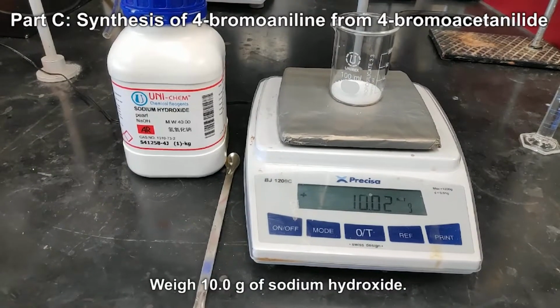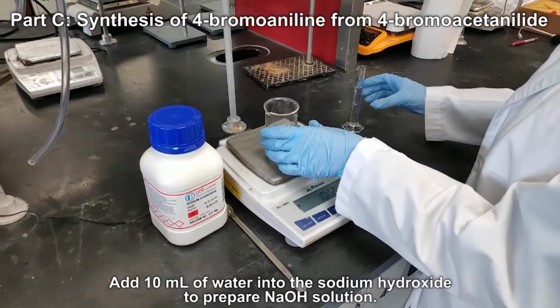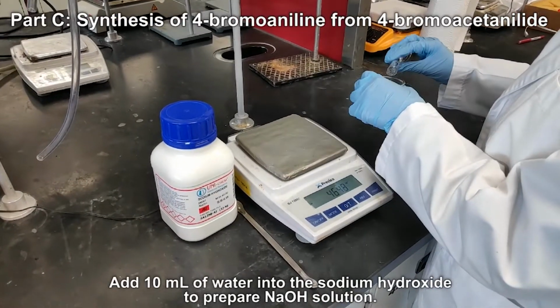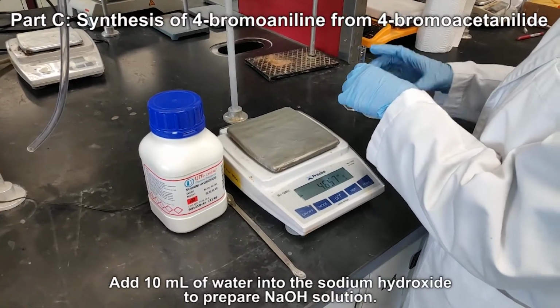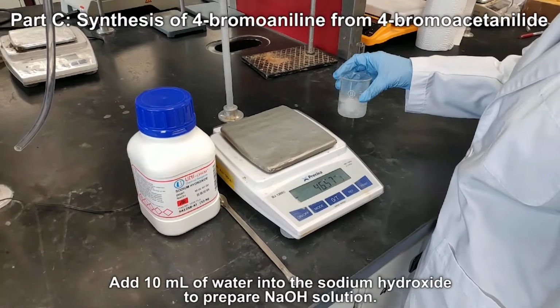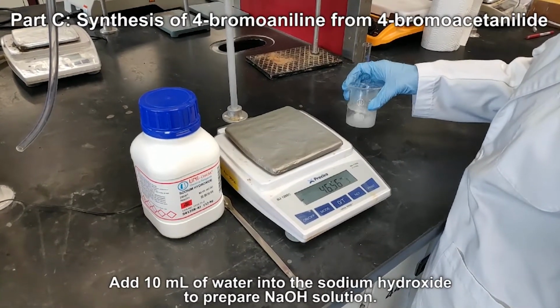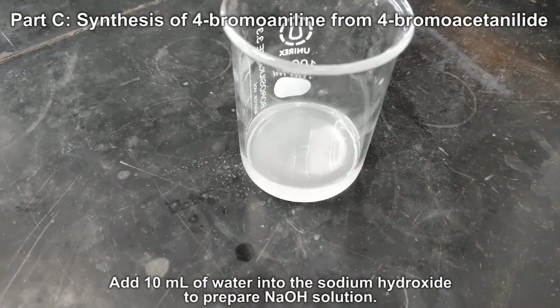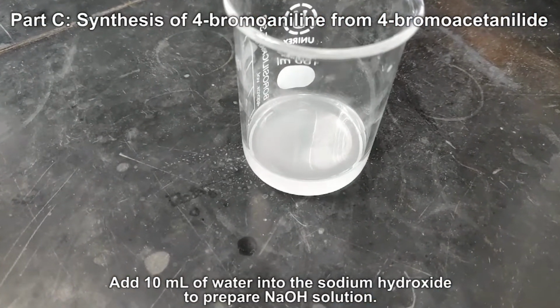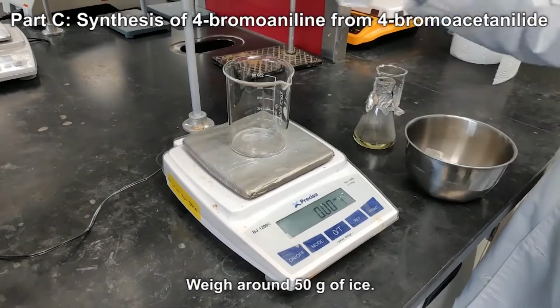Weigh 10.0 gram of sodium hydroxide. Add 10 ml of water to the sodium hydroxide to prepare sodium hydroxide solution. Weigh around 50 gram of ice.